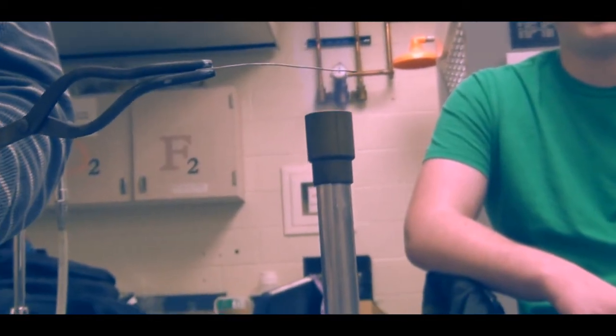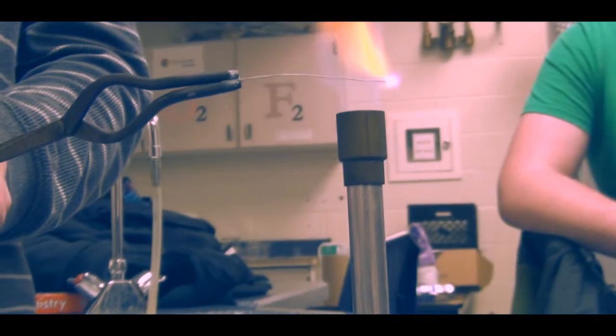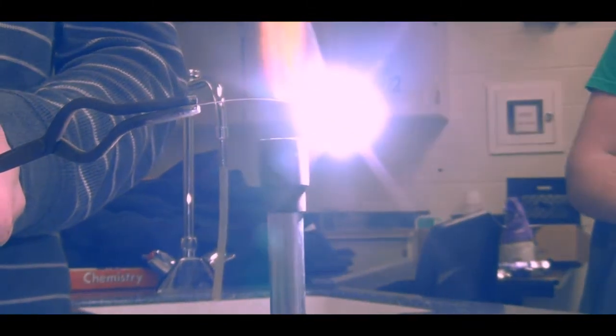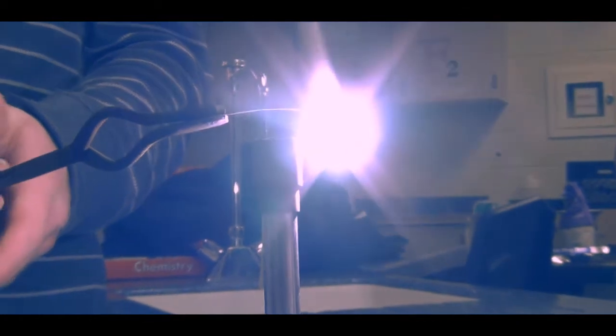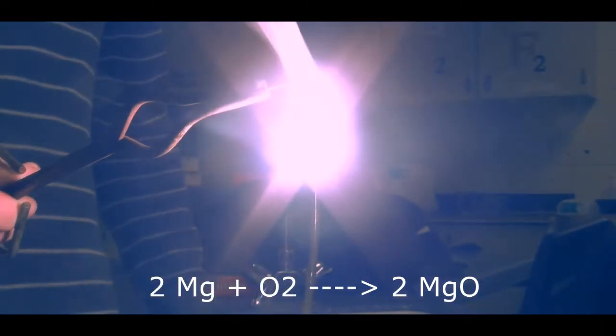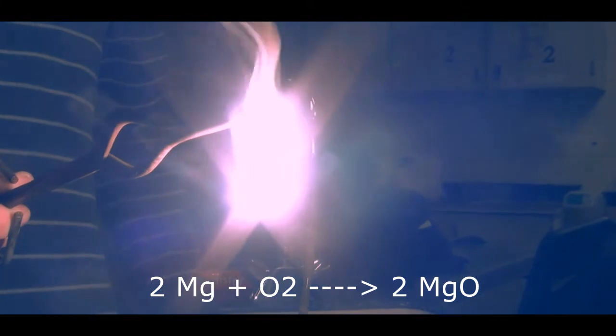Our third reaction type is a synthesis reaction. This is the polar opposite of a decomposition reaction, as 2 simple compounds or elements combine to form a more complex compound. What you are seeing is the synthesis of magnesium with oxygen, forming magnesium oxide.